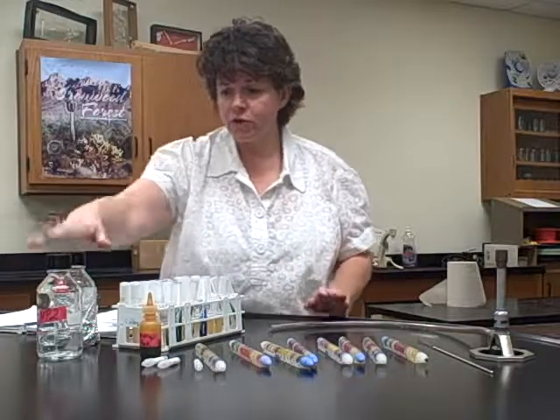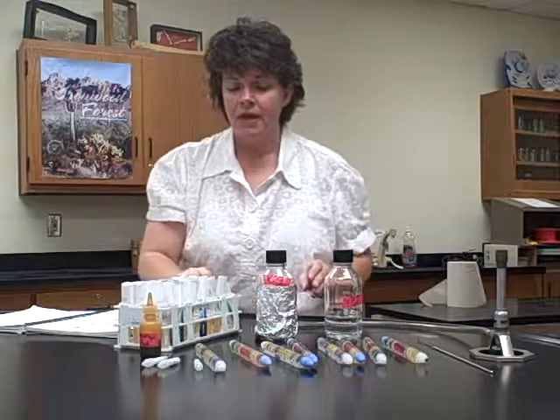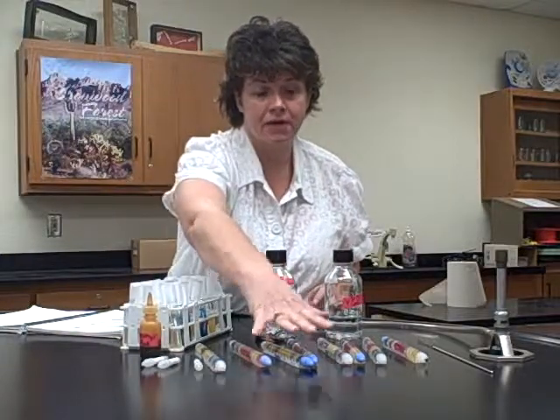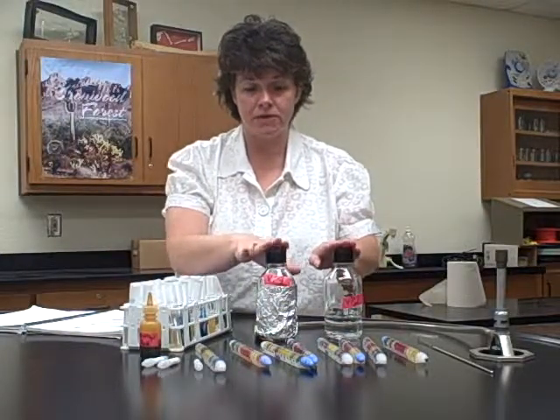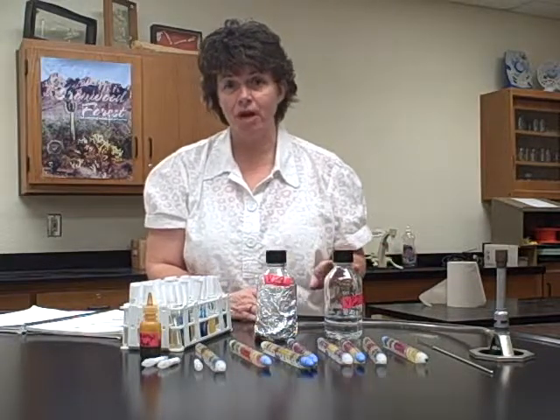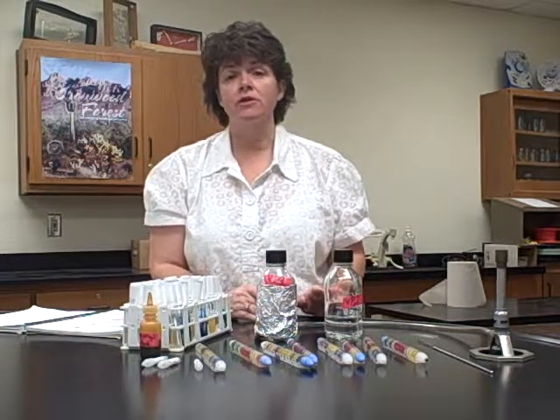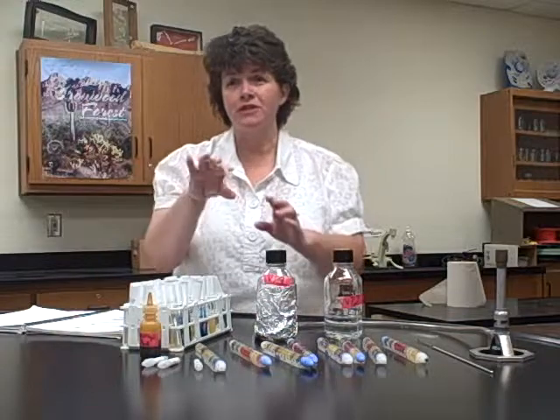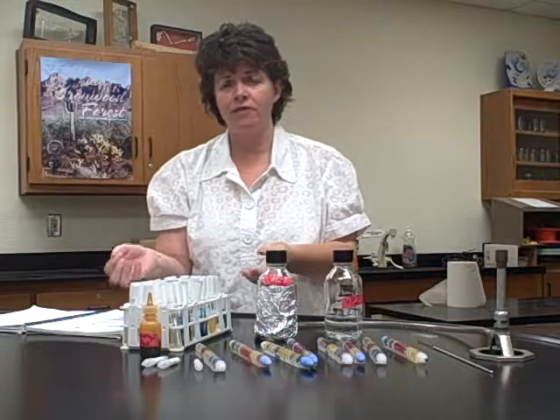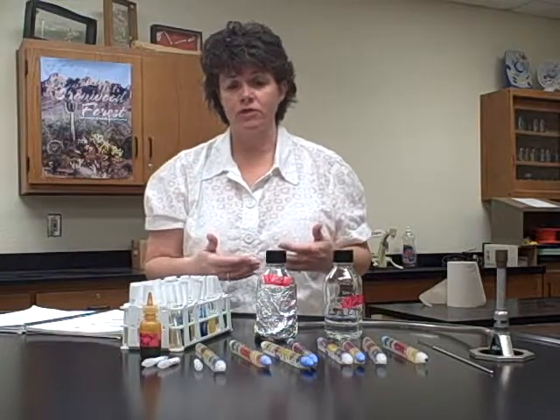So you're going to use the bottles from last time from the fermentation of carbs, and you're going to do that with the tubes themselves. We have little ampules for these here, but for the tubes you use the big bottles like you did before, and once again go back to fermentation of carbs and see how many drops of each you need to add. Also remember that this test takes 20 minutes, and so you use the parafilm and you shake it up a little bit. I don't know if you invert it, but shake it up a little bit, and then you take the parafilm off and you let it get oxygenated for 20 minutes, and then you look for the result.